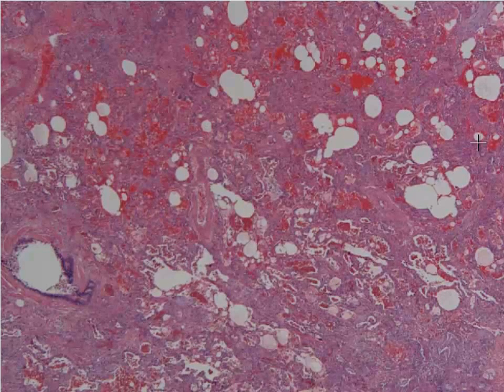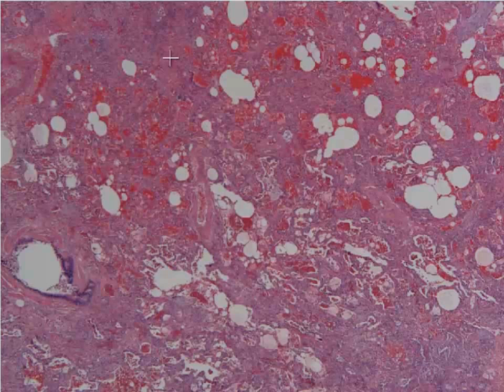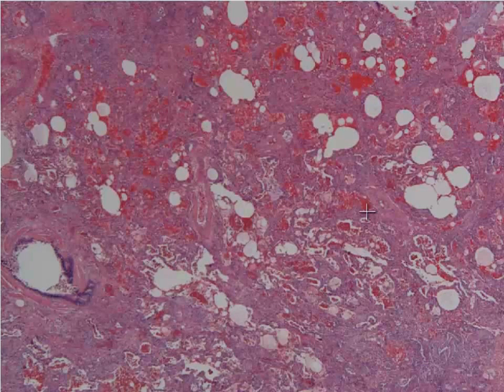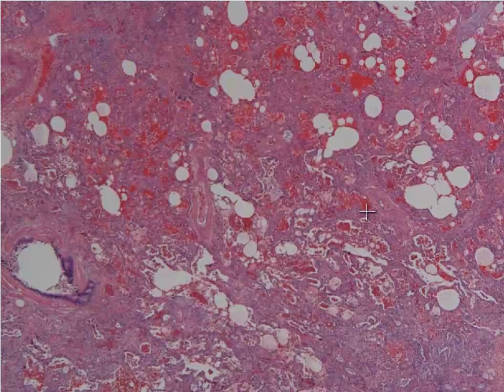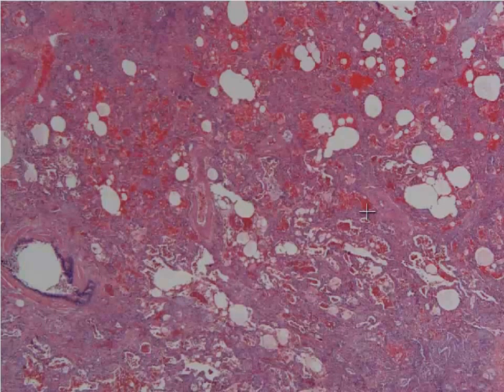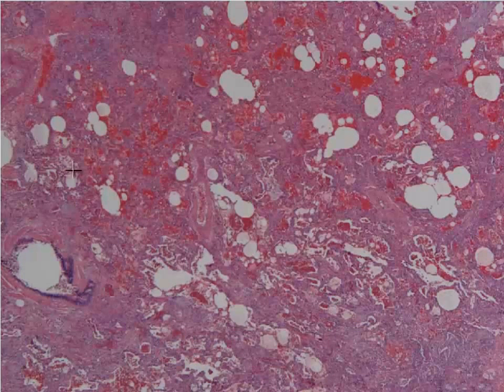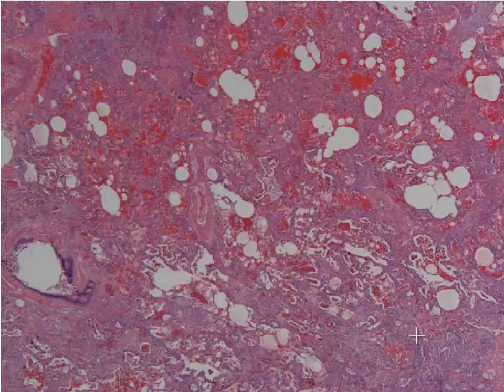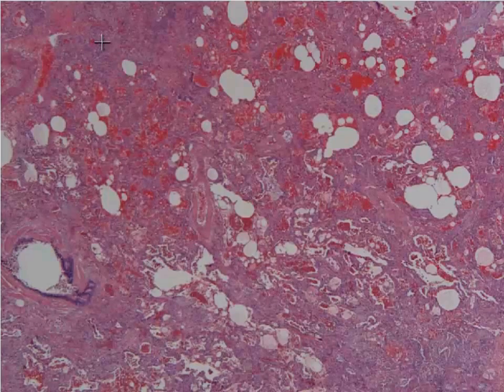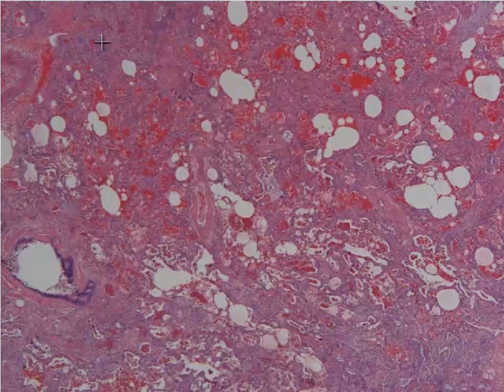We'll start at low power and you can see that this is lung — believe it or not — a very fibrotic lung. One of the defining features of this disease is what we call temporal heterogeneity, which means that different areas of the lung are being affected at different times. You can tell there are areas here where it's completely fibrotic, which presumably would have been affected a long time ago.